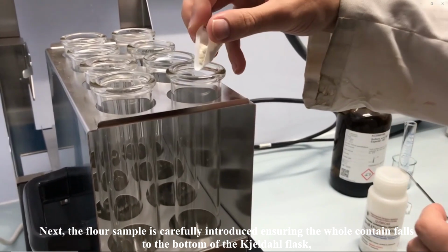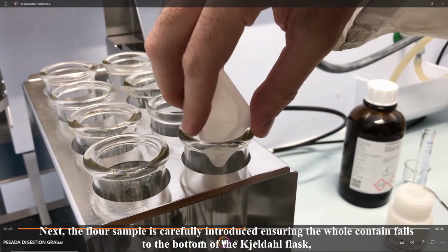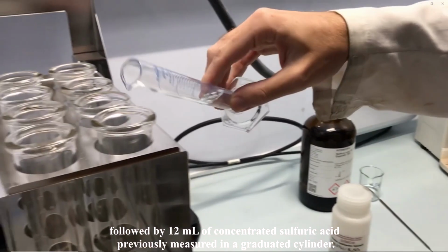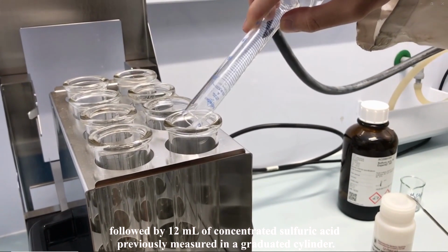Next, the flour sample is carefully introduced, ensuring it falls to the bottom of the Kjeldahl flask, followed by 12 milliliters of concentrated sulfuric acid previously measured in a graduated cylinder.